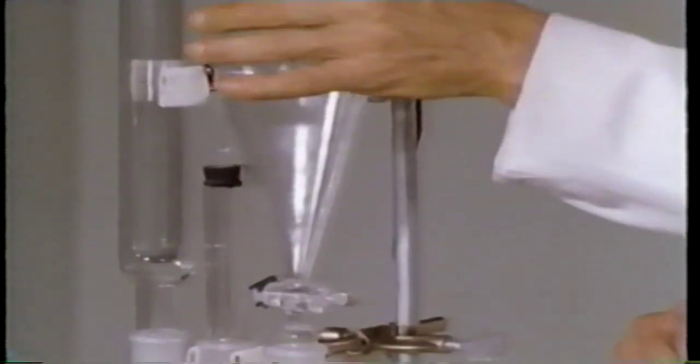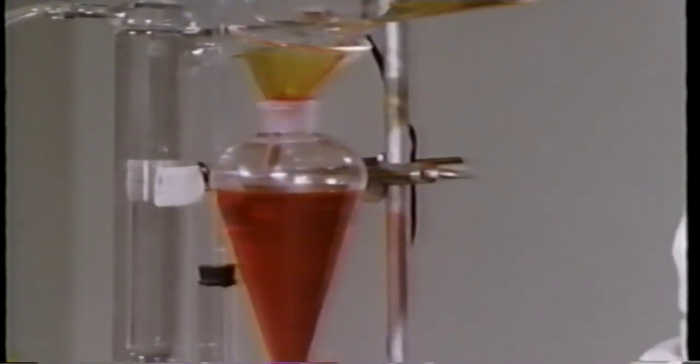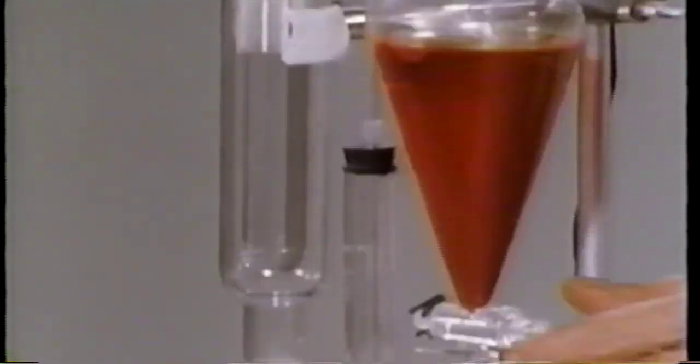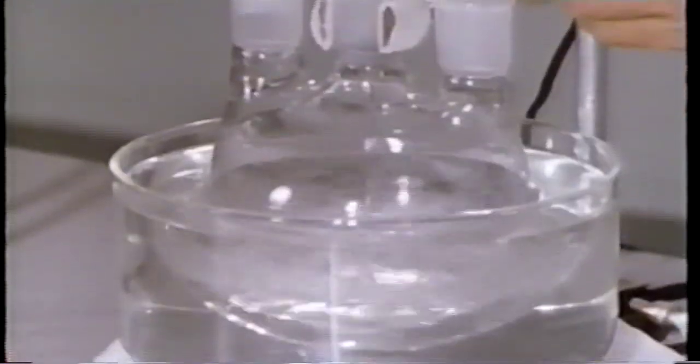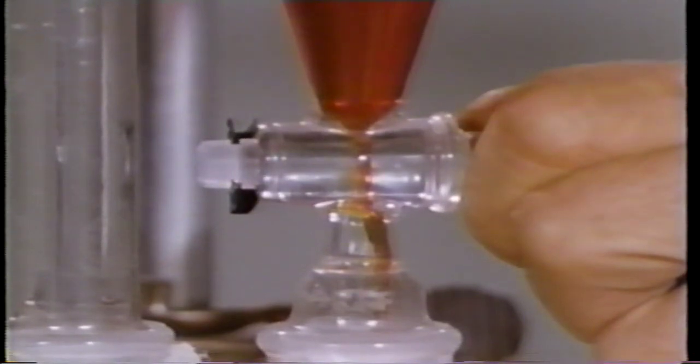Now that the solution of butanol in ether is ready in the reaction flask, the orange-colored oxidizing solution made from sodium dichromate, sulfuric acid, and water is poured into the dropping funnel. Ether and water do not dissolve appreciably in one another, so a mechanical stirrer is used to ensure that the 2 solutions will mix well enough for the reaction to take place. Add the dichromate solution to the flask at a controlled rate.